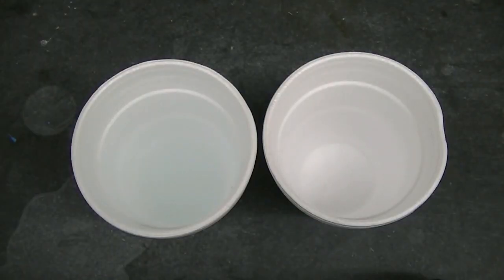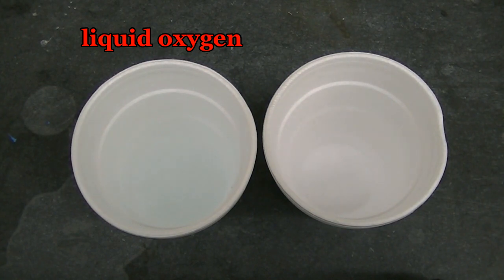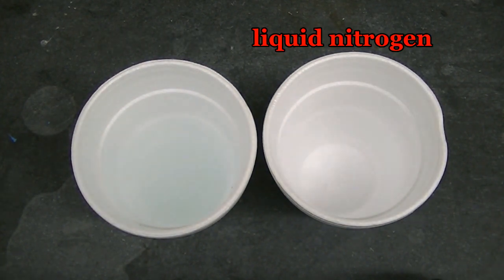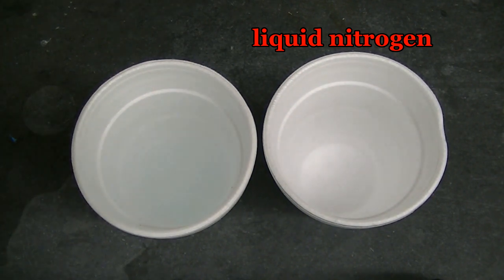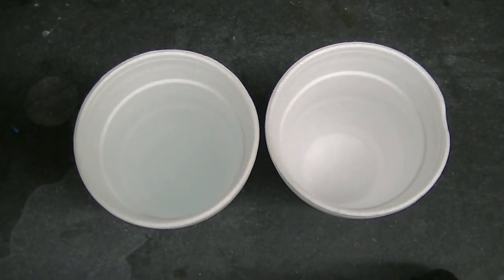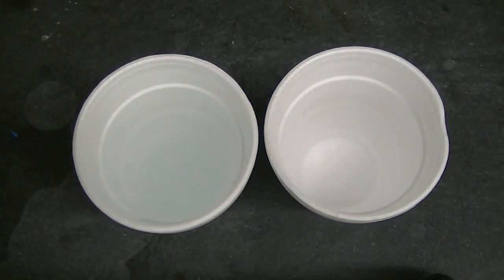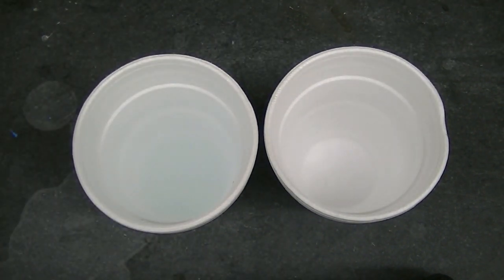We're going to compare the properties of the liquid oxygen that we collected, which is in the cup on the left, with the properties of liquid nitrogen, which is in the cup on the right. The first thing to notice is a slight pale blue color in the liquid oxygen. Liquid oxygen is indeed known to have a slight blue color.